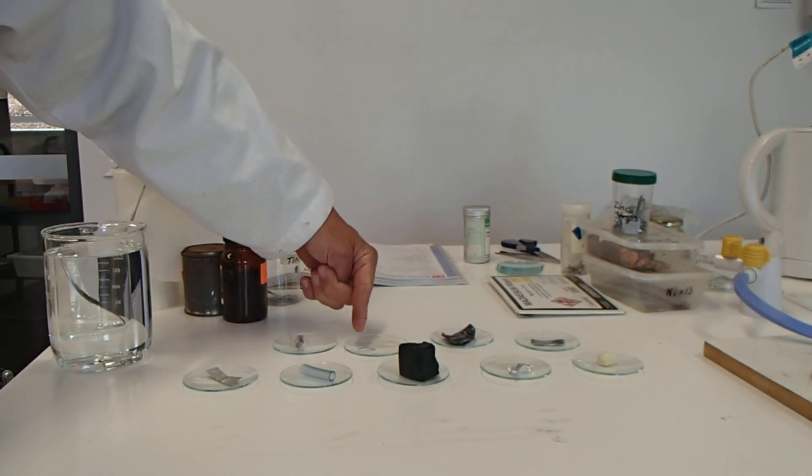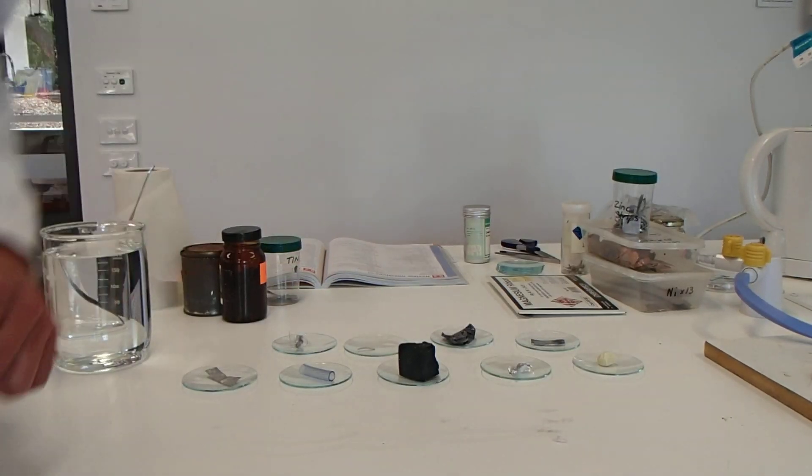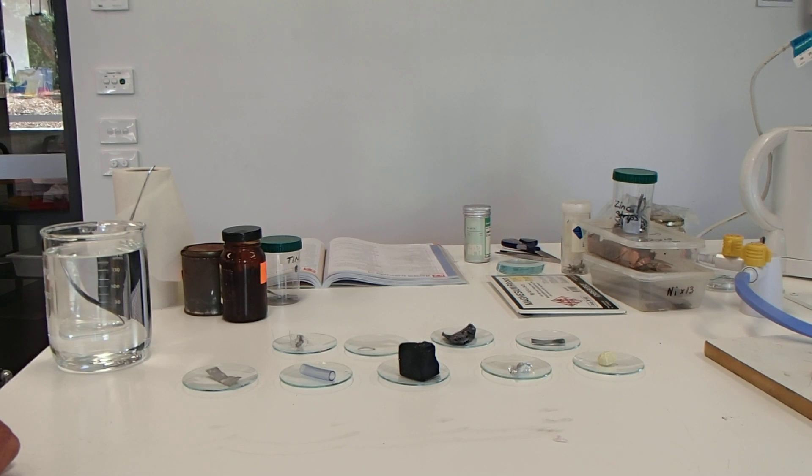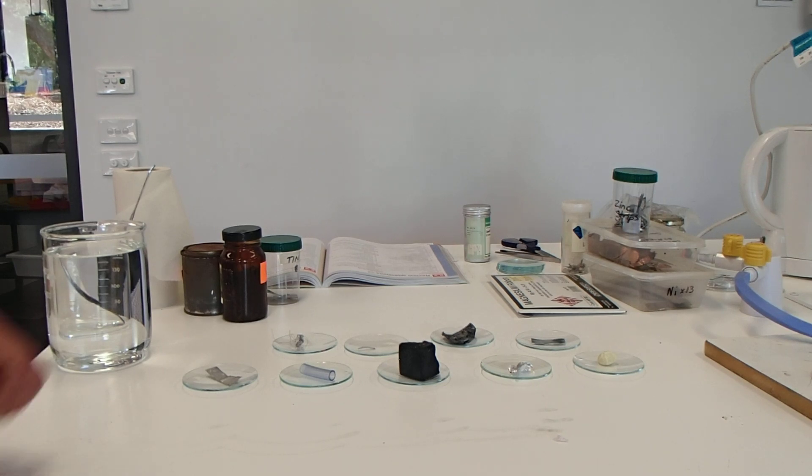All of these are pure substances in their pure form, and the first test that we're going to do—we'll be doing five tests today, this will be the first video, so there will be five separate videos—the first test today is just looking at the appearance of each.